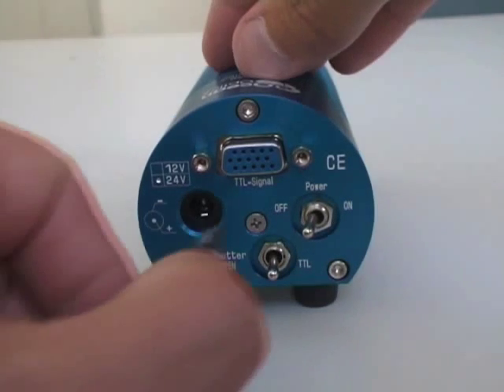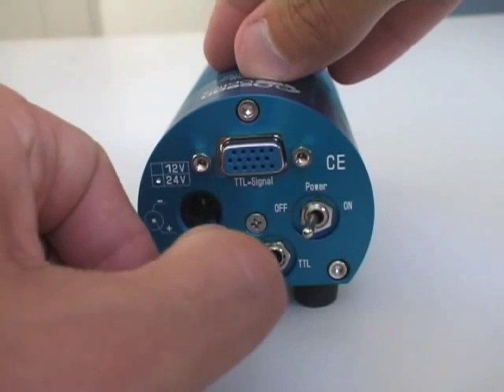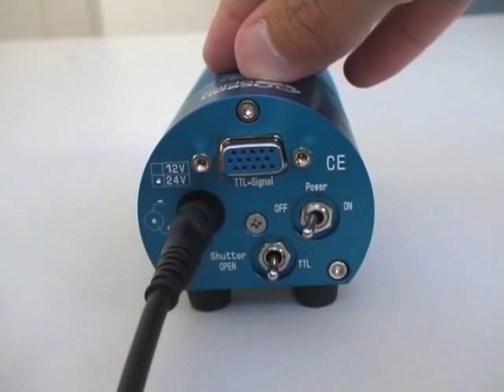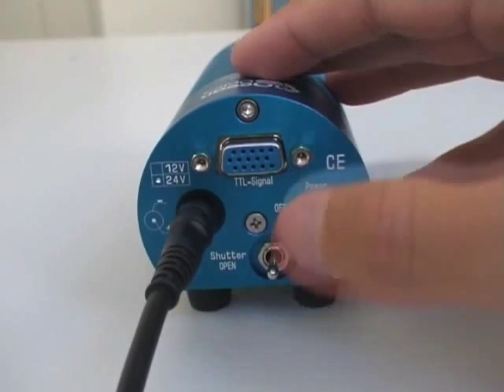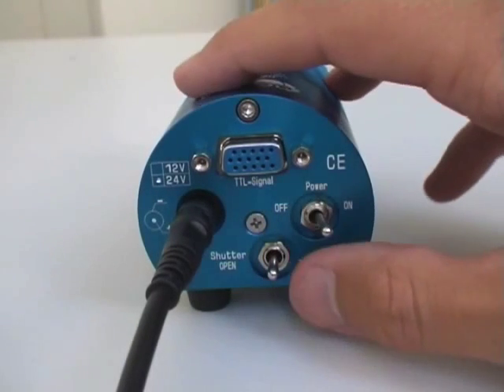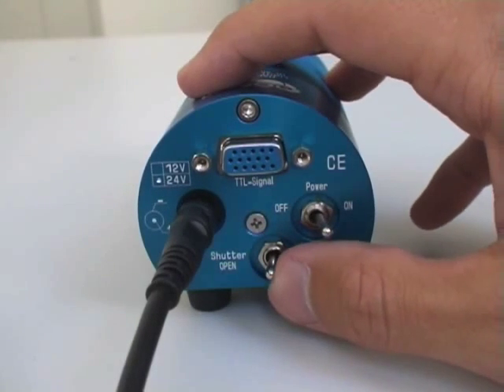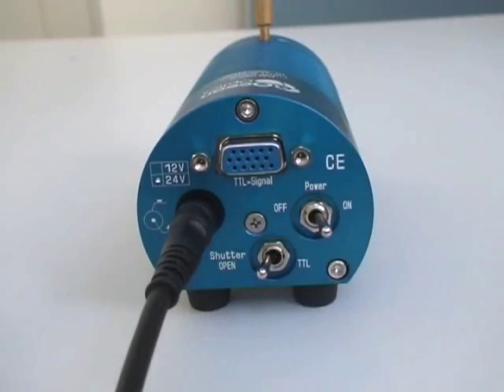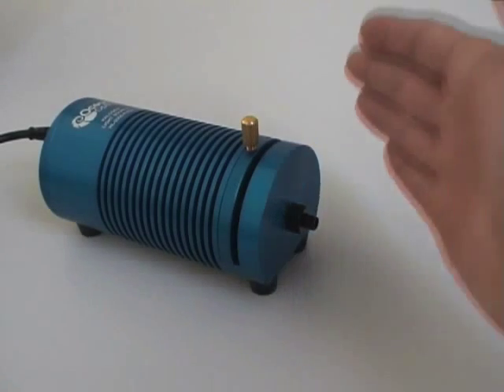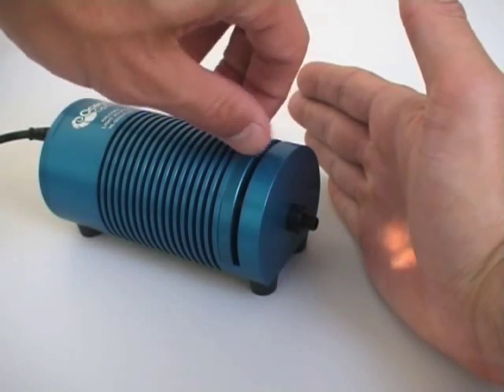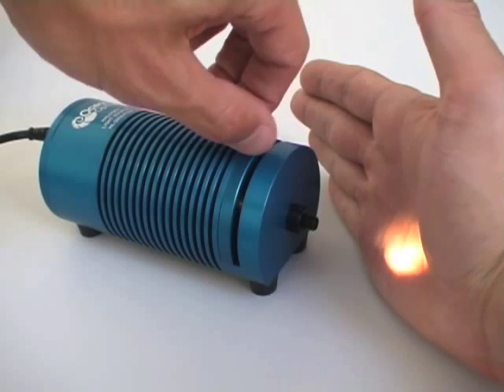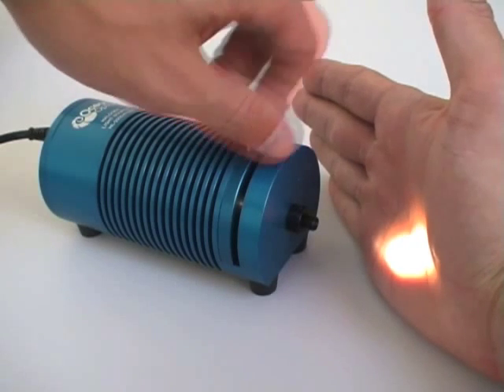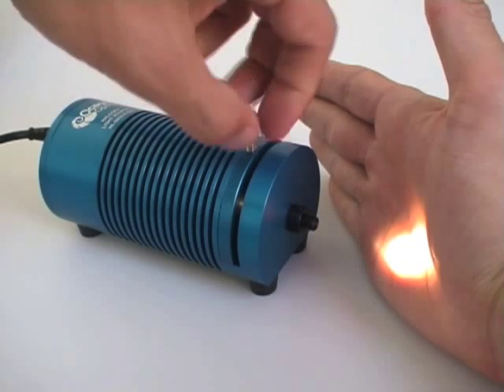Connect the power supply to your lamp, turn it on and open the shutter if your light source has one. Check that light is coming out of your light source. If not, it might be that the attenuator is fully closed. Open it completely.